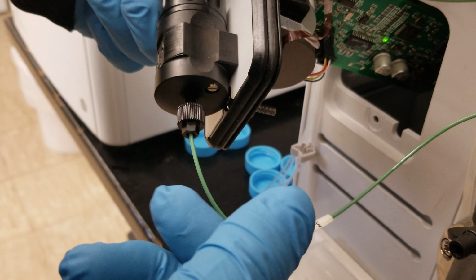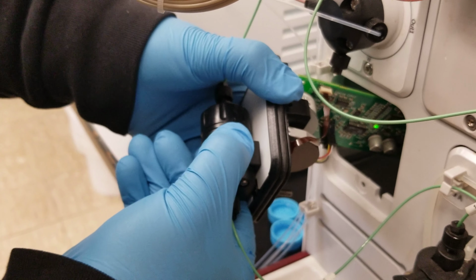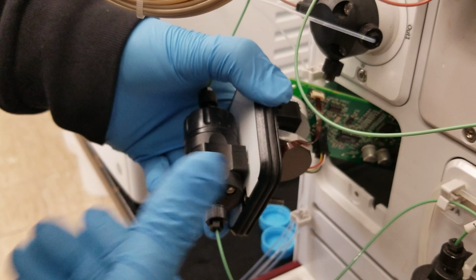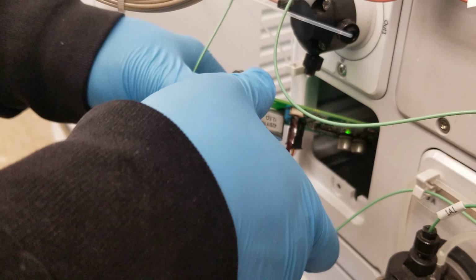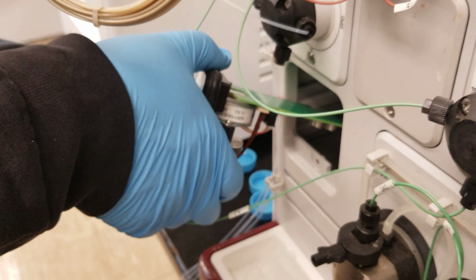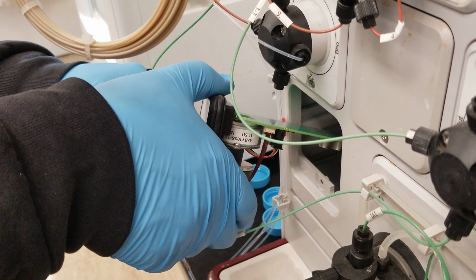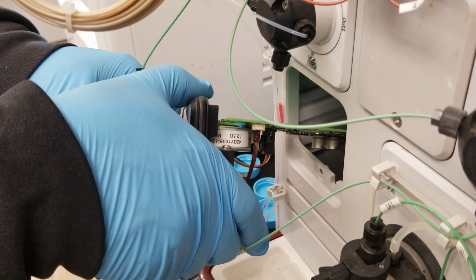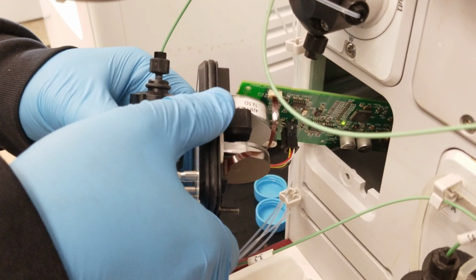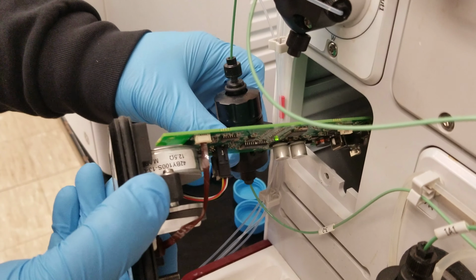Can you disconnect that piece? Yeah, sure. Try it. Just be gentle. Okay, hold on. Because that thing is connected. So. Yeah. Okay. Well, that won't tell anything at this point. So, this keeps moving without the mixer.